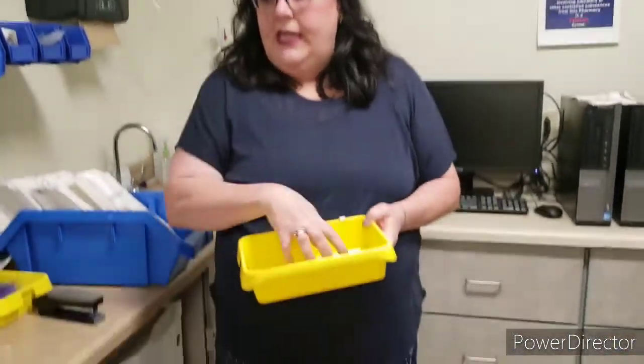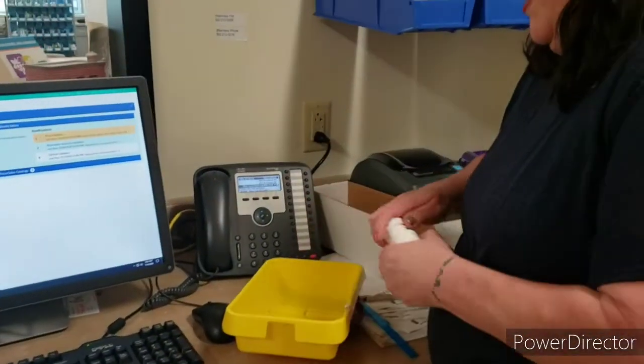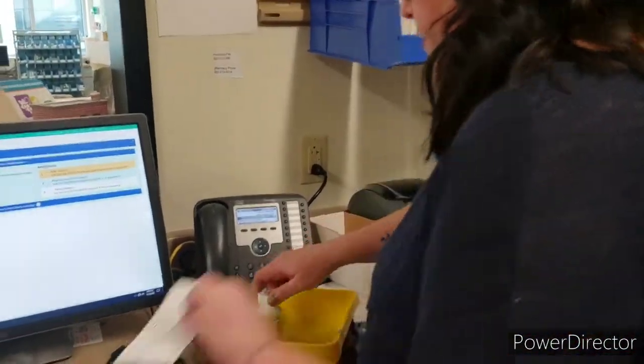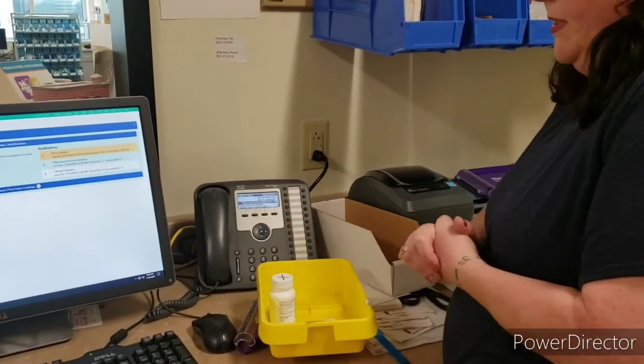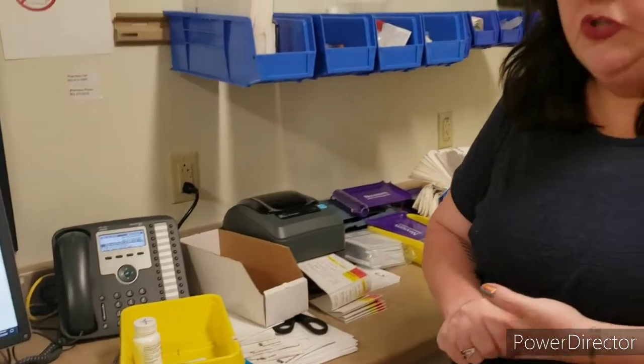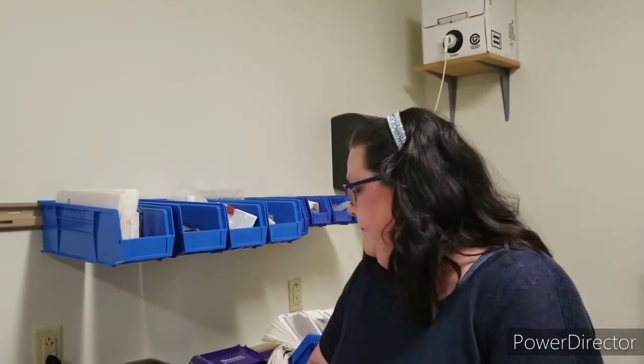You can also, as you're working, because as you can tell, we have 4 students back here at once, maybe 2 if we're still following social distancing rules, you can use one of these to keep all of your stuff together. So if this was our drug, our prescription, the bottle we put it in, we can keep it all together until the final check, because the pharmacist has to do the final check on anything that leaves the pharmacy.